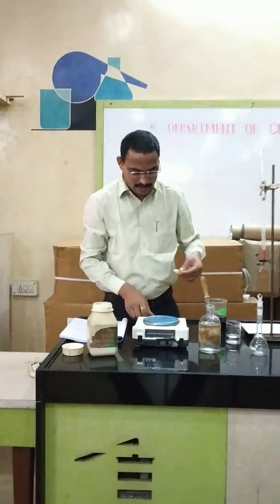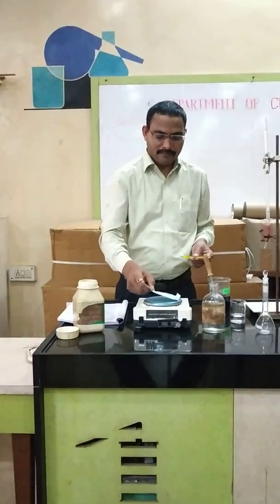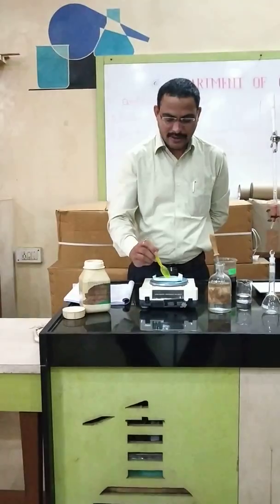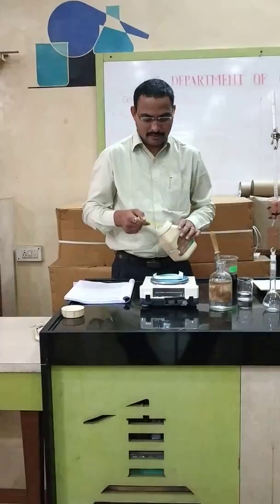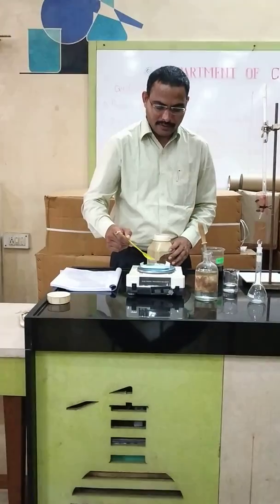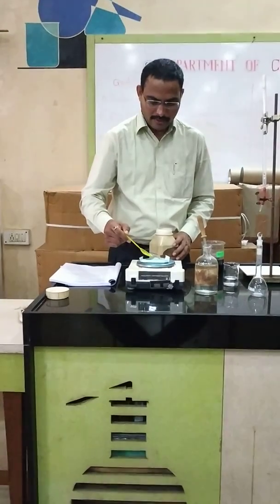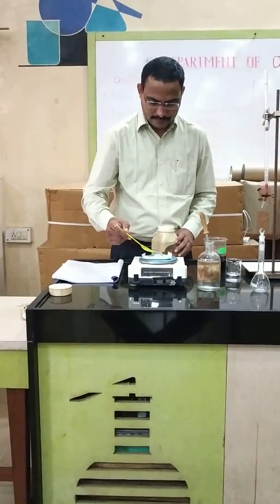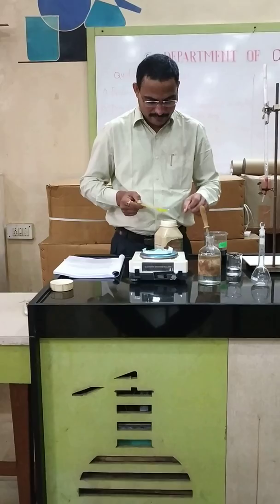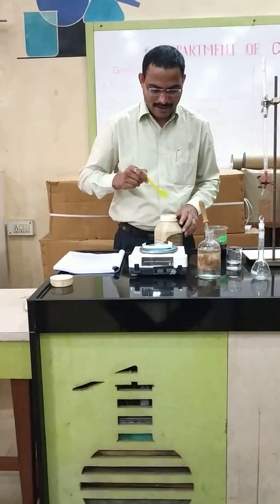As usual, in physical chemistry practicals that you learned in 11th standard, first of all you have to take the weighing paper. This is weighing paper, not the balance pan. Tare the weight of this paper, and take 3.92 grams of Mohr's salt — ferrous ammonium sulfate — accurately. 3.92 is the molecular weight of 0.1 molar ferrous ammonium sulfate. You should get an accurate weight using this highly sensitive digital balance.